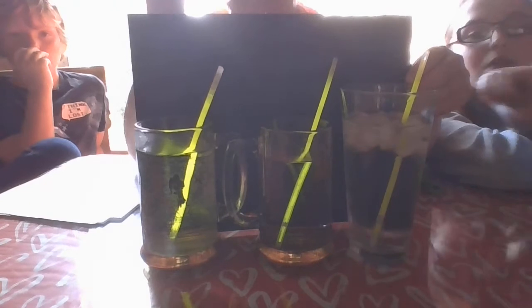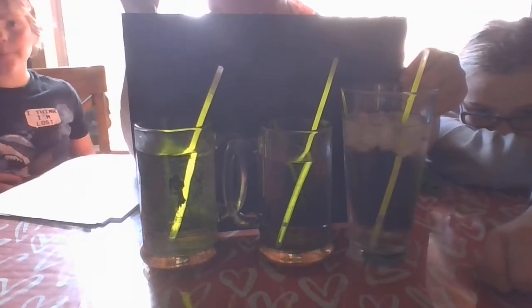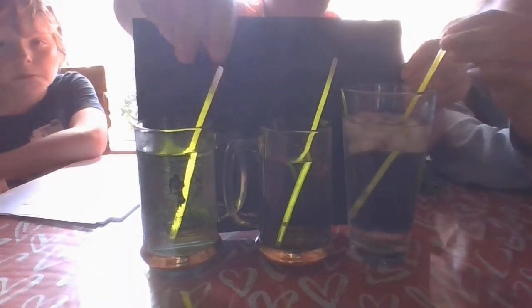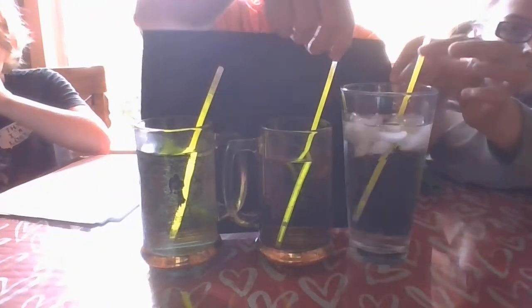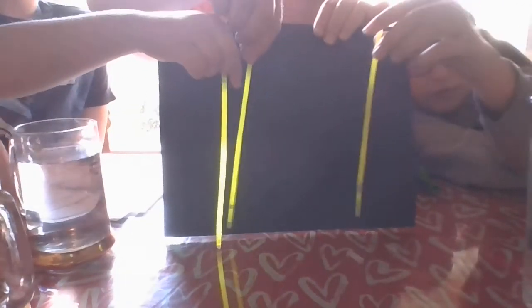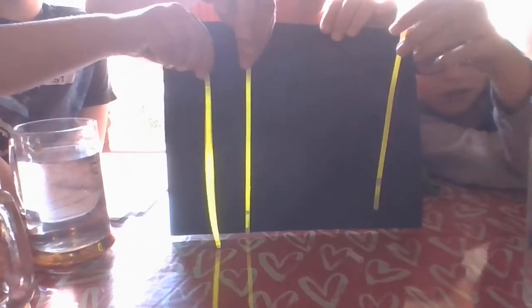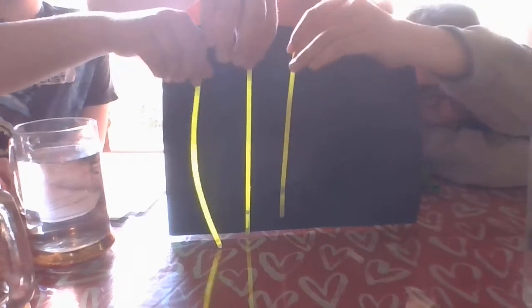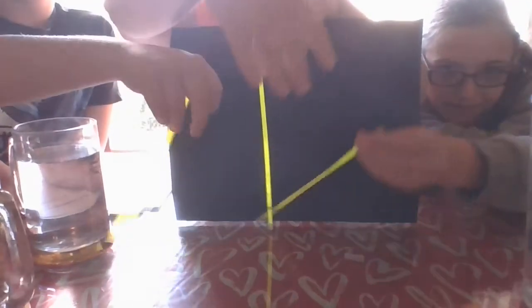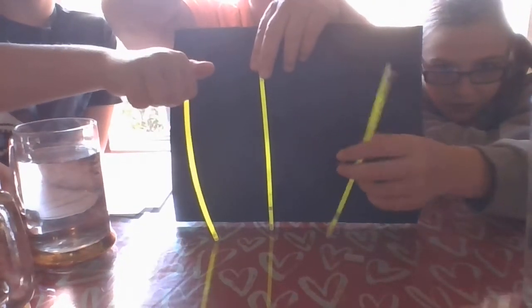Hopefully you can kind of see now, and we'll take them out in just a minute and put them next to each other. Alright, Jace grab the hot, we're going to put them right in front of the glasses so they can all see. Josie grab the cold, Jace grab the warm — I'm going to put the warm in the middle. So you see how bright Jace's is? And how light Josie's is. Jace's here is the hot, this is the warm, and Josie's is the cold. Make sure you're answering our questions. That's the end of experiment one.